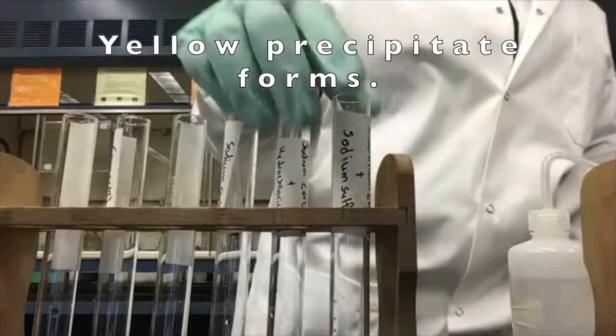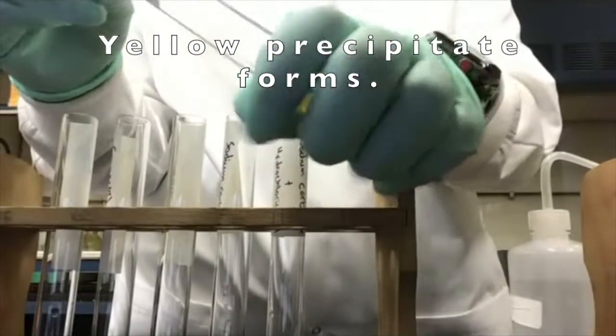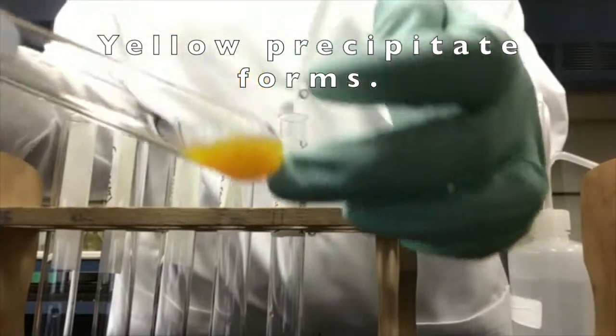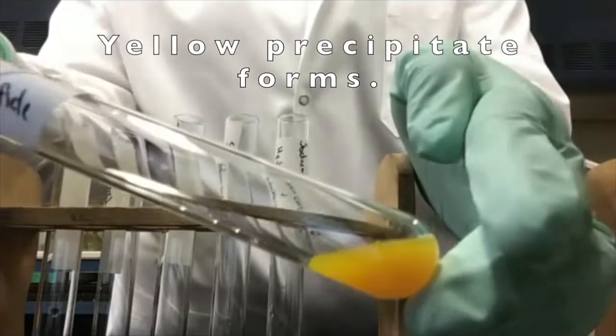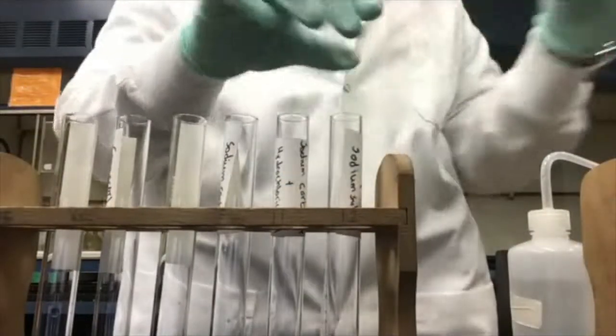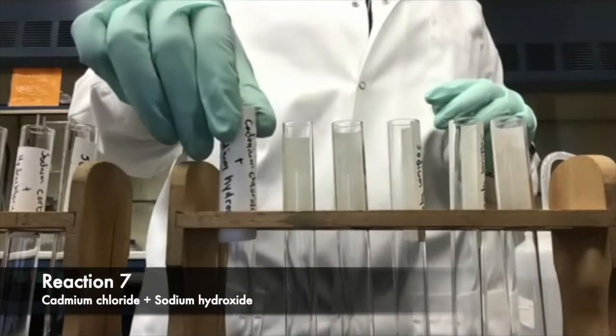Our cadmium chloride and sodium sulfide solution makes a bright yellow precipitate in our test tube. Reaction 7 is cadmium chloride and sodium hydroxide.